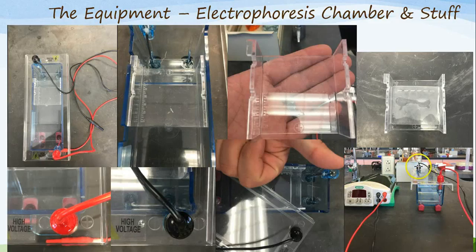How do you hook this up again, you say? Well, the black wire goes into the black hole. Make sure you push this in all the way as to secure a connection with the power supply. The same thing is to be said about the red wire. It goes in the red hole. I know, it's something of genius. What do you do after that, you say? You're going to have to wait and get instructions from your instructor.